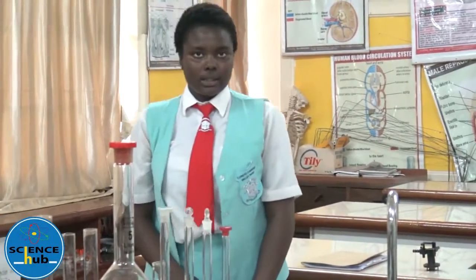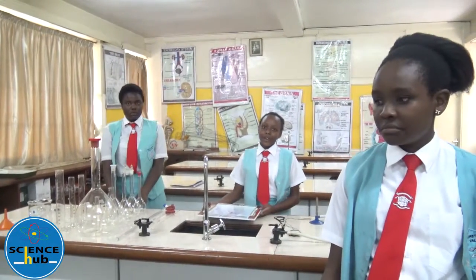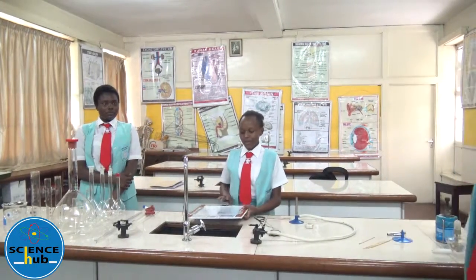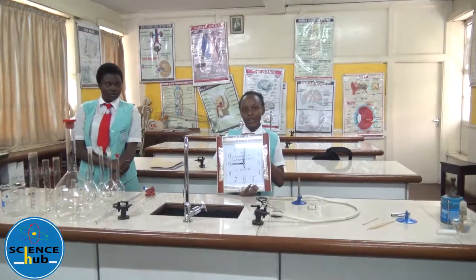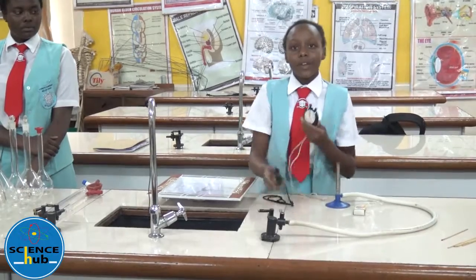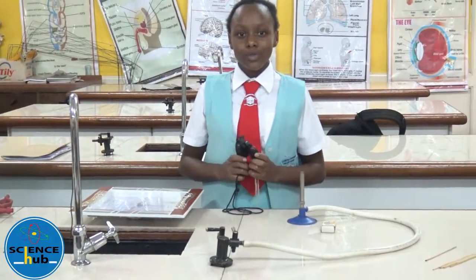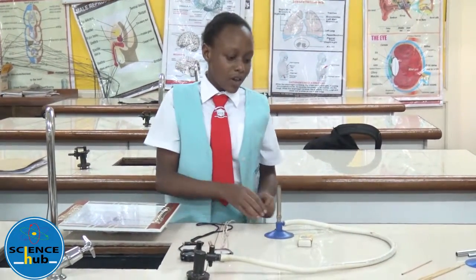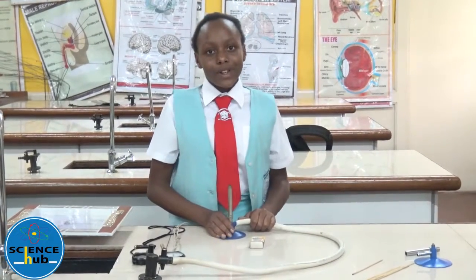Here we have apparatus that are used to measure time. For example, this is a wall watch, it is used in the laboratory to measure time. Here we have the digital stopwatch and the analog stopwatch, which are also used to measure time.